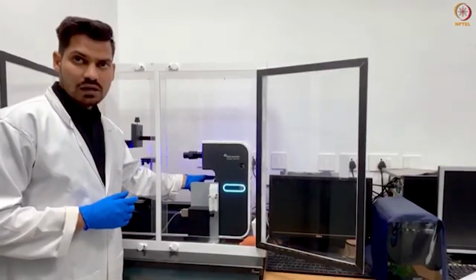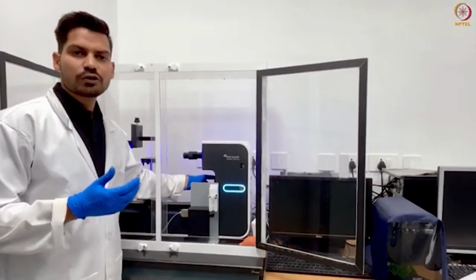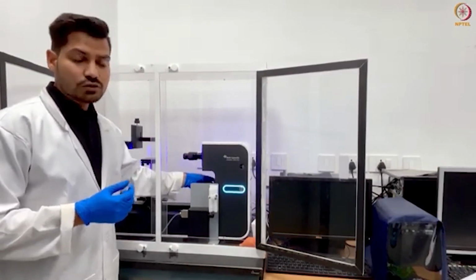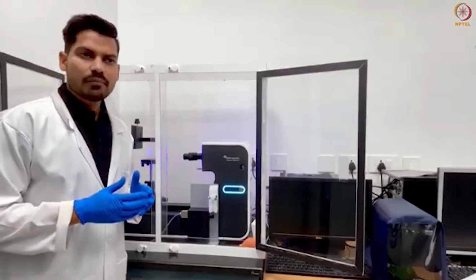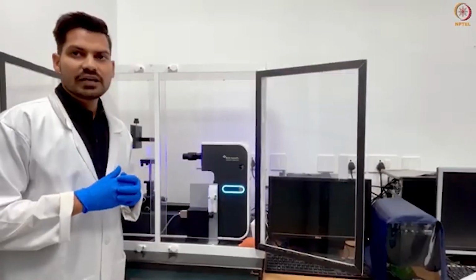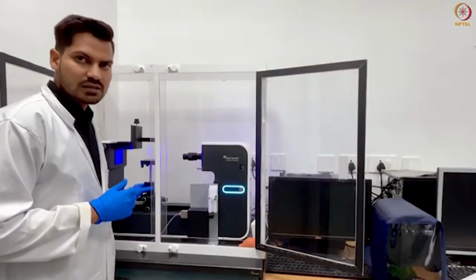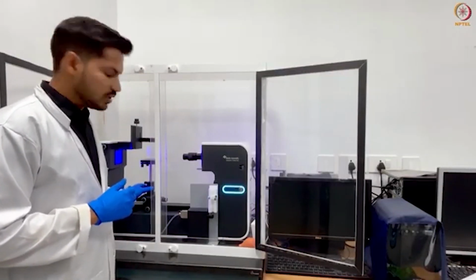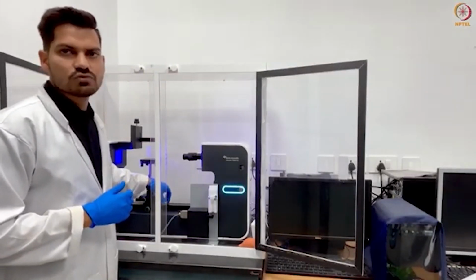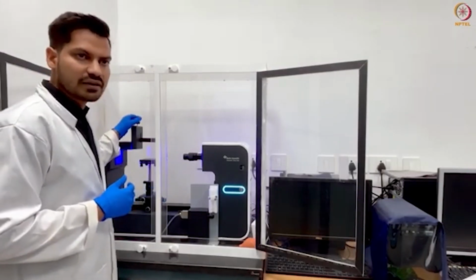By rolling this ruler, you can adjust the tilt angle of the camera, especially for sessile drop measurement, when you are going to measure the contact angle using the sessile drop method, right? In that case, we have to keep this camera at -2 degrees. You can actually see the surface and the formed droplet on the surface. With the help of that, you can calculate the contact angle of the system. Also, this stage can move manually like this. You can move it up and down manually. You can adjust the z-axis, y-axis, and x-axis one by one using these tools, which are readily available in the system. You can also adjust the height of the cantilever beam for hanging the syringe.